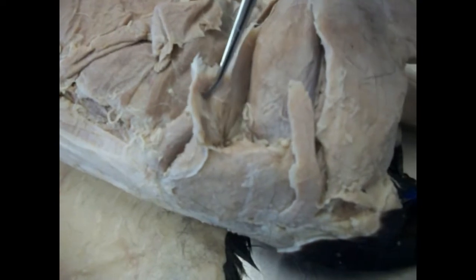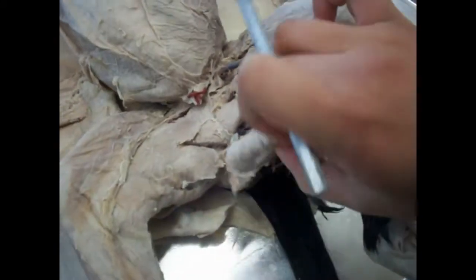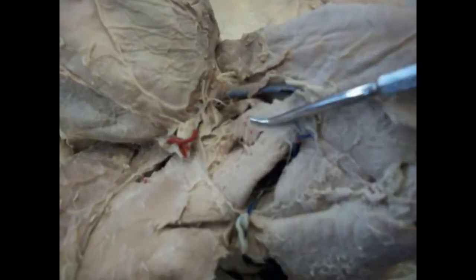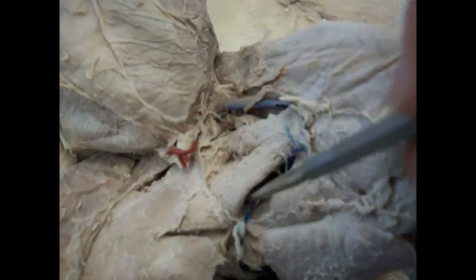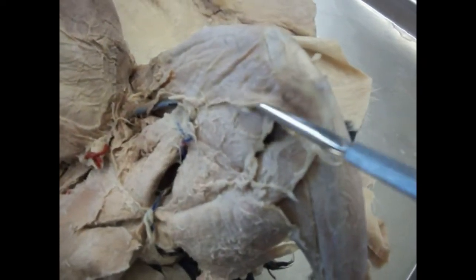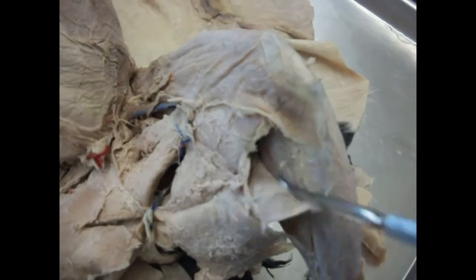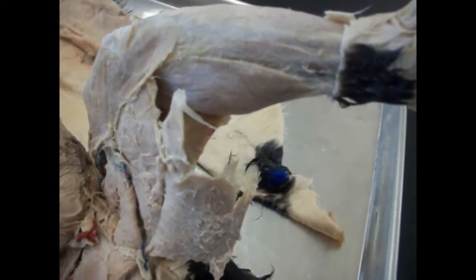Now as I retract this superficial muscle, to the left of the caudofemoralis, it is known as the tensor fasciae latae. Now let's move to the ventral side of the cat. Now this superficial muscle that moved down for you is known as the gracilis, and underneath is known as the vastus medialis, behind the rectus femoris, and underneath that is the adductor femoris. As we move down, the superficial muscle is known as the semimembranosus, and at the end of the leg, known as the calf, is the gastrocnemius.